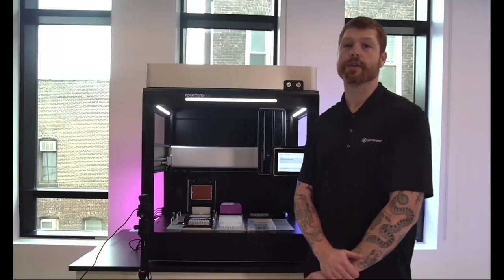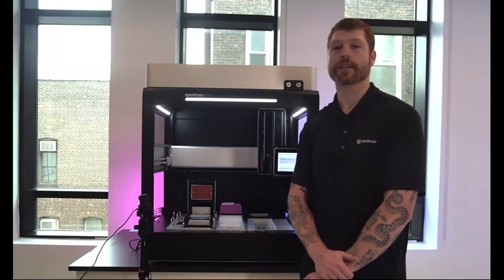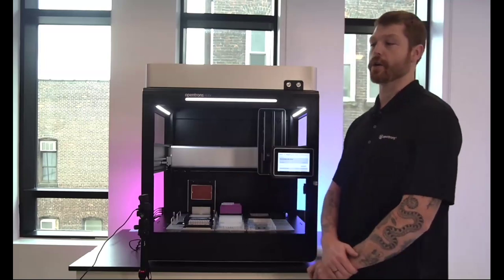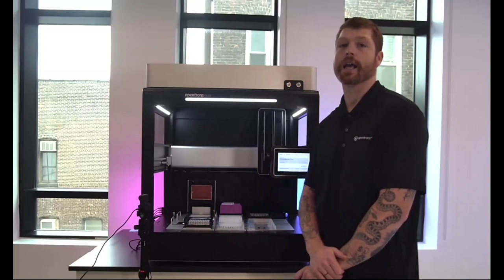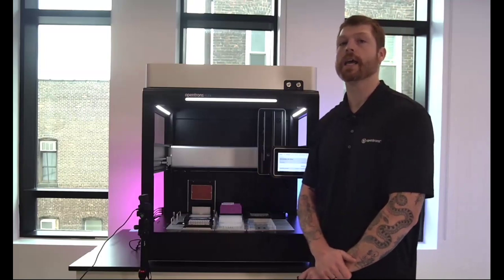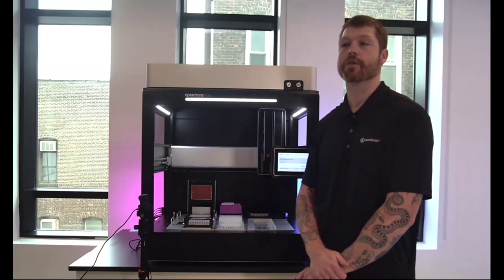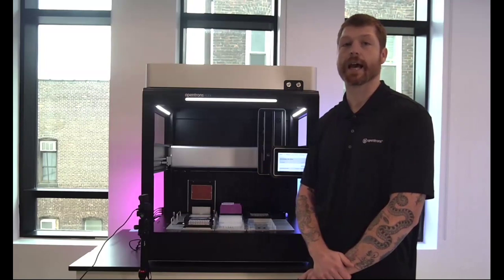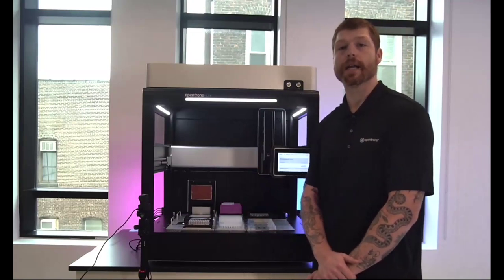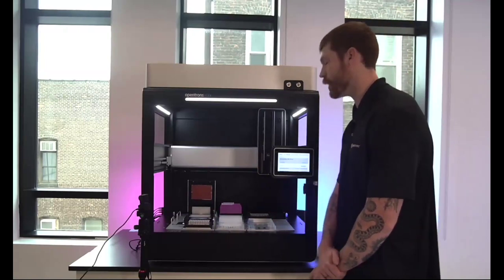So I'm going to show you a few key features on the Flex first, and then we'll go through some live demos of a few of the key software features that we'll be releasing tomorrow. As you can see next to me here is the Opentrons Flex instrument. It's a single gantry system to move in the X and Y. On the gantry, there is the ability to hold 2 pipettes and also a gripper to move SBS format labware. In the back of the instrument here, we have 2 pipettes currently configured. We have a single and an 8-channel.